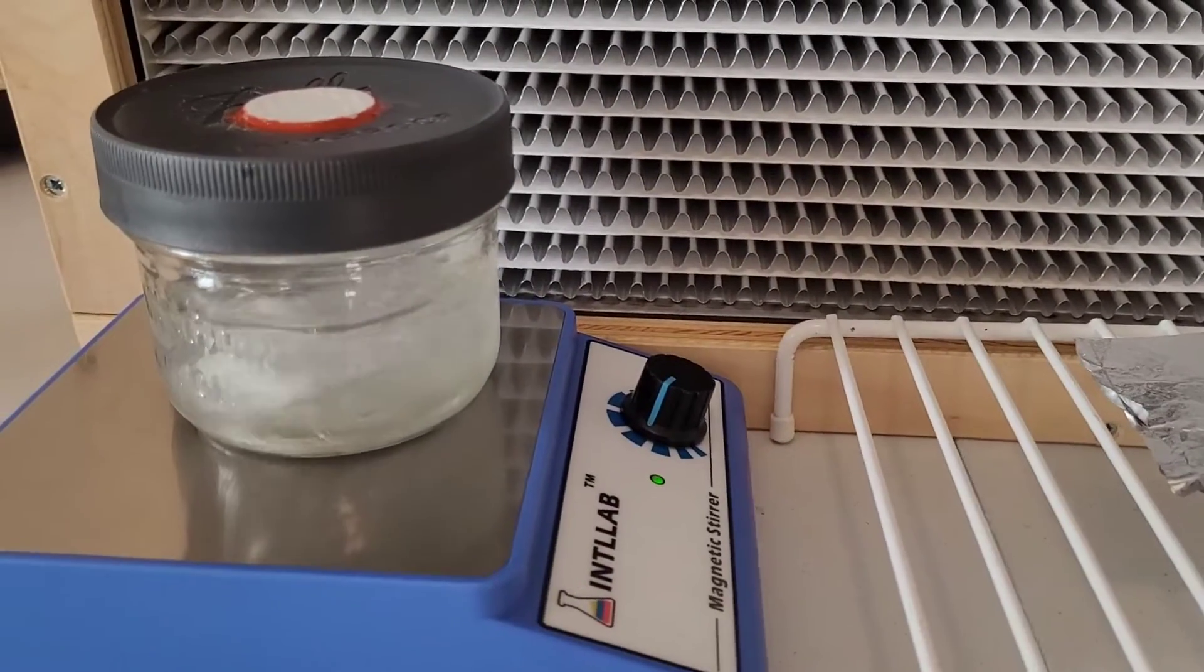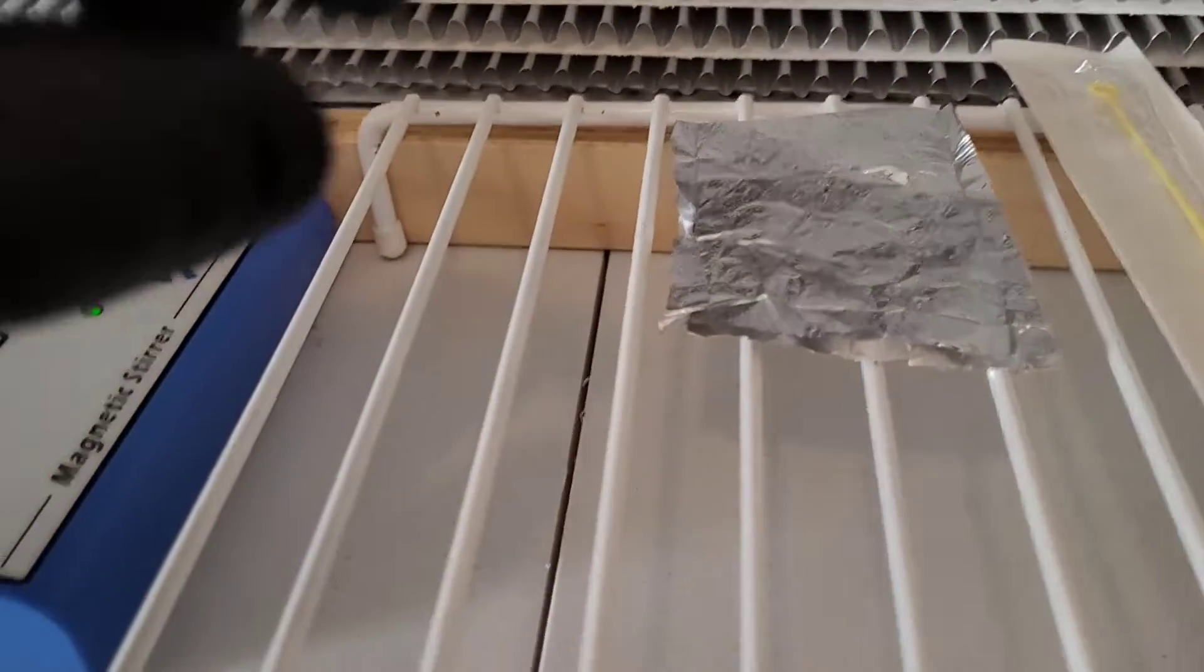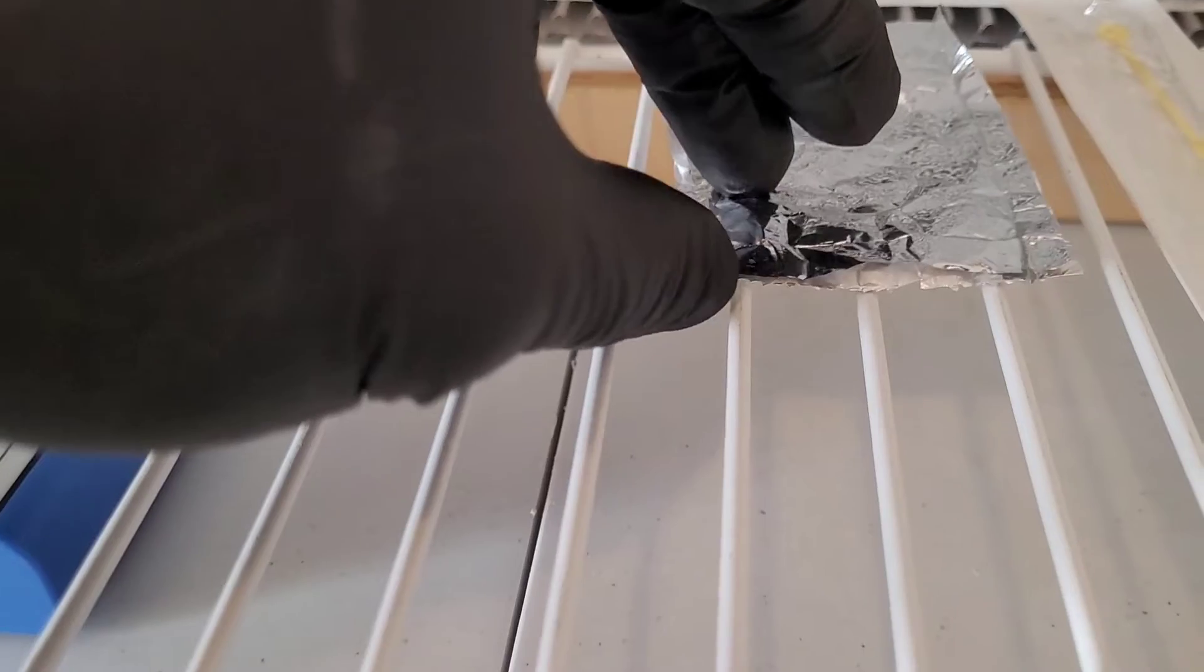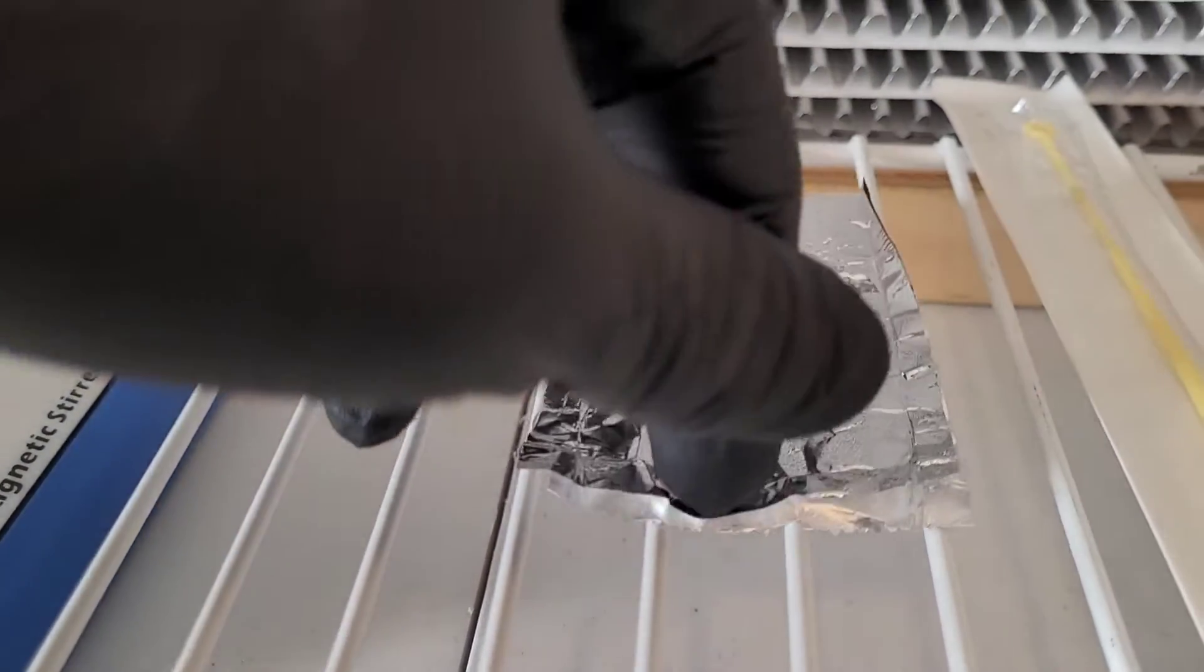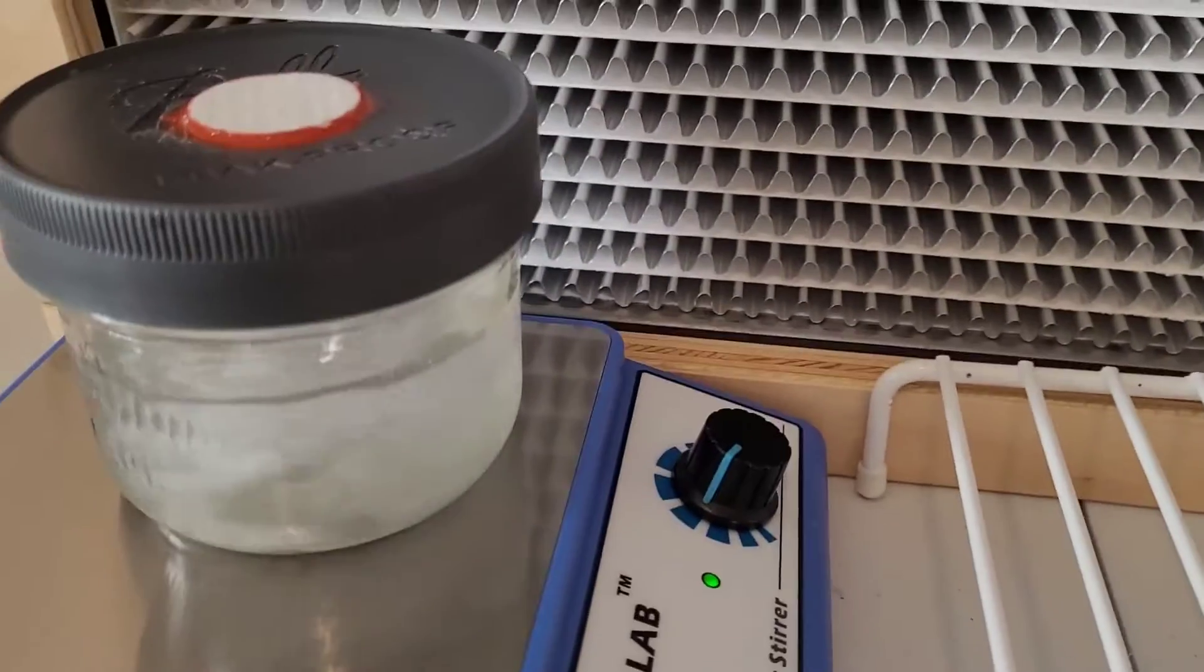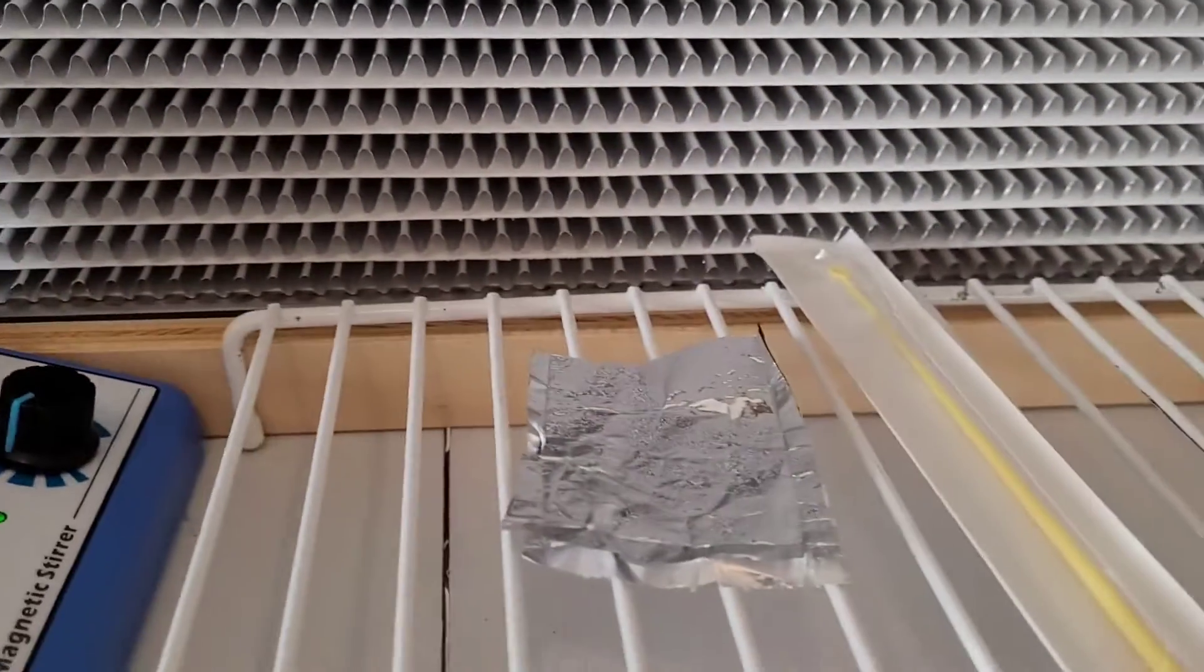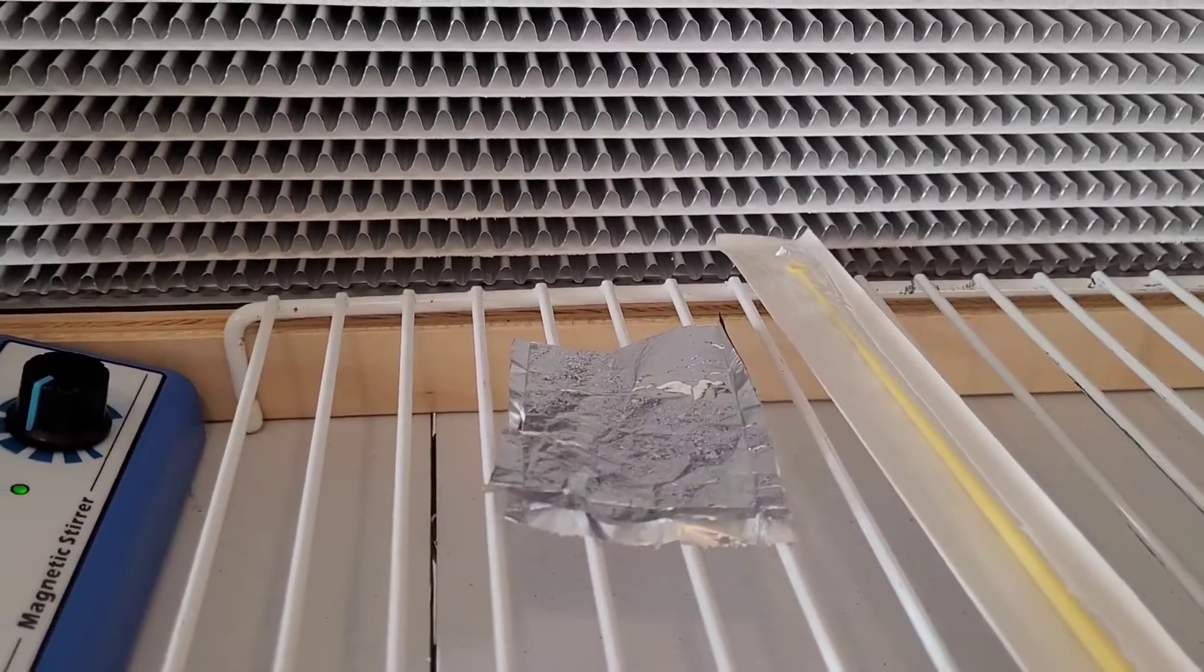Water is out of the PC and it's now cooling in flow. This is the spore print that I'll be using. That entire print will be getting scraped into this jar. The print is two years old so it's definitely due for some hydration.